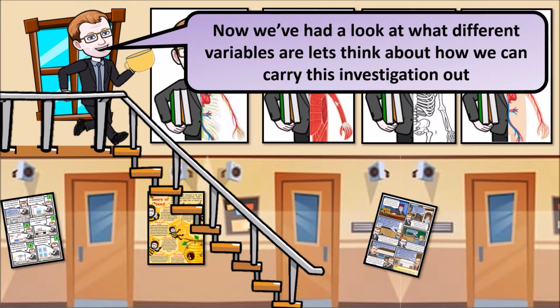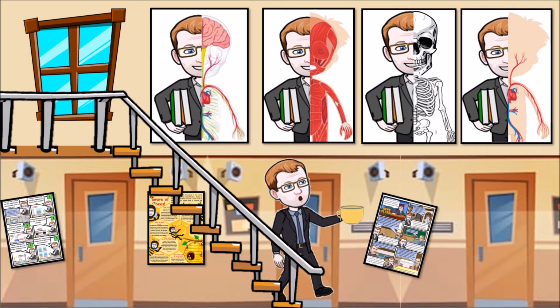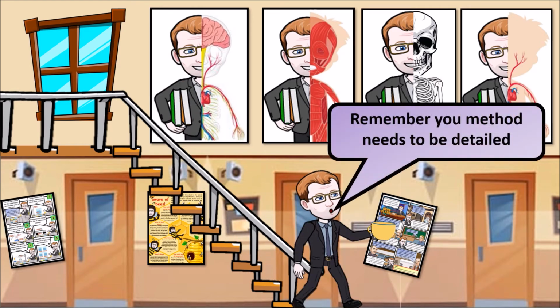Now that we've had a look at different variables and things, we can look at how we carry out the investigation. So remember, when you're putting a method together, it needs to be detailed.